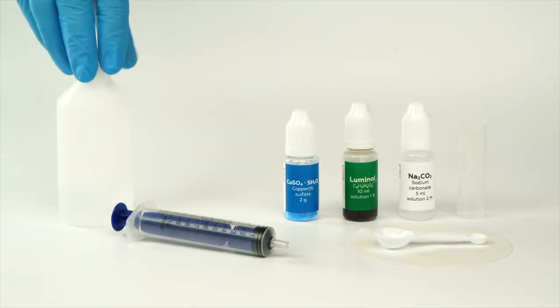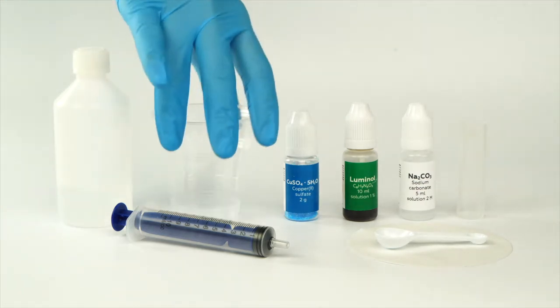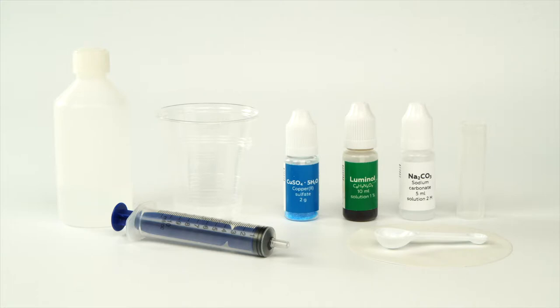Prepare some 3% hydrogen peroxide and a disposable plastic cup in advance. Conduct this experiment in a room that you can easily make very dark.